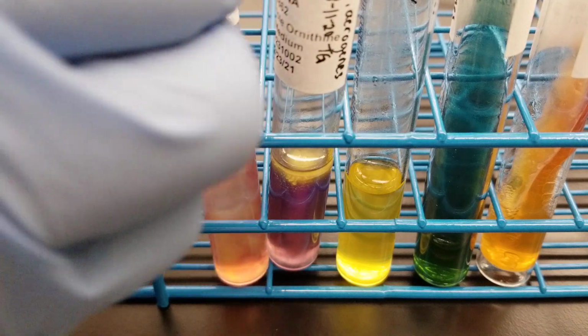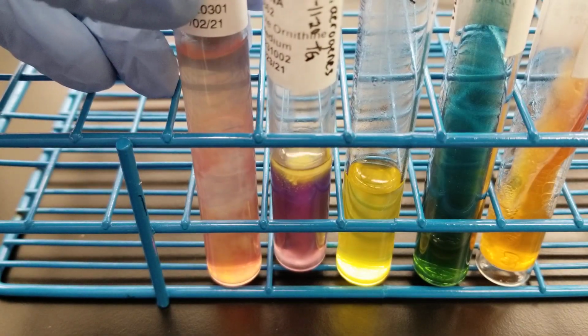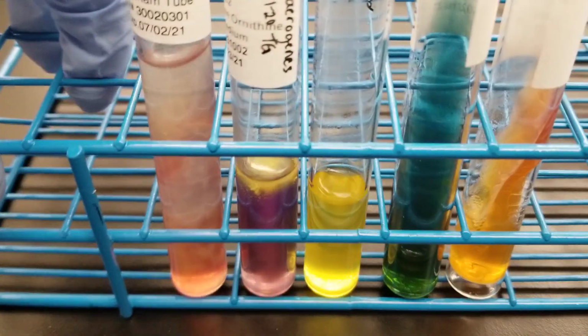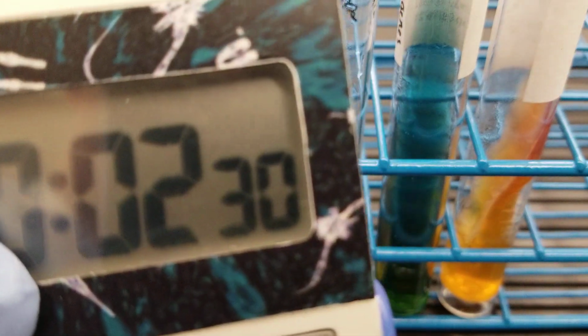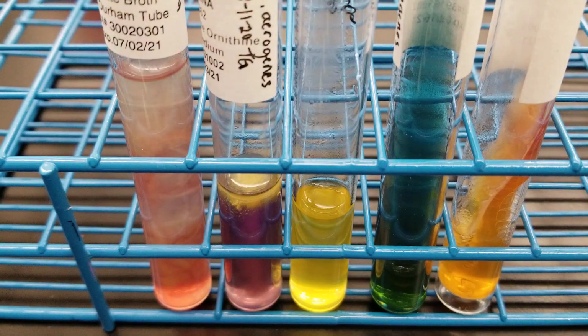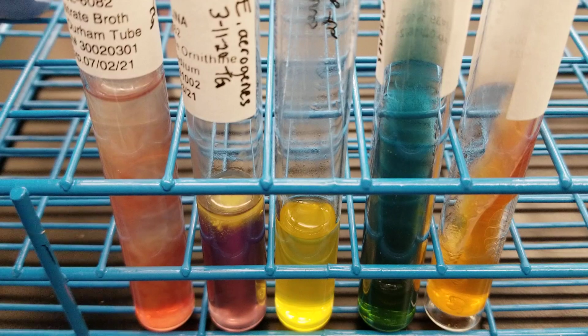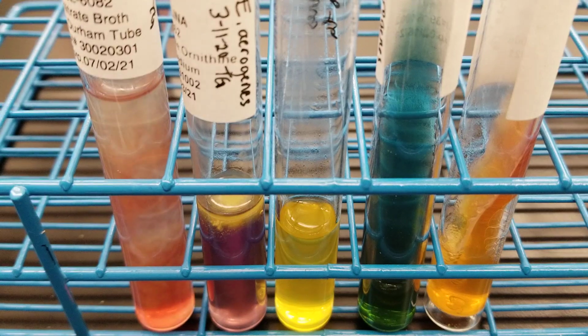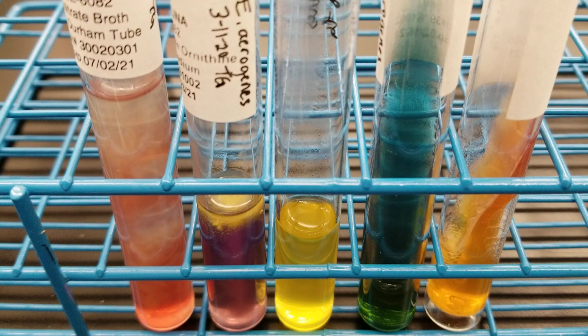This is after 24 hours of incubation of all of these tubes together, and this is what you will see. So it's only taken a minute so far, and we already have that beautiful red color change, and that's exactly what we should have. So this is perfect. These are perfect results for this organism, and we're going to continue.